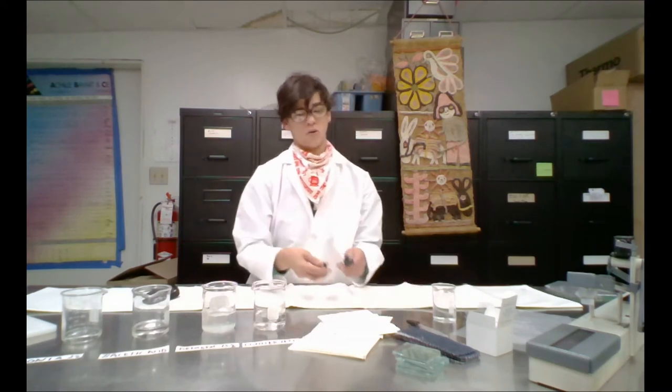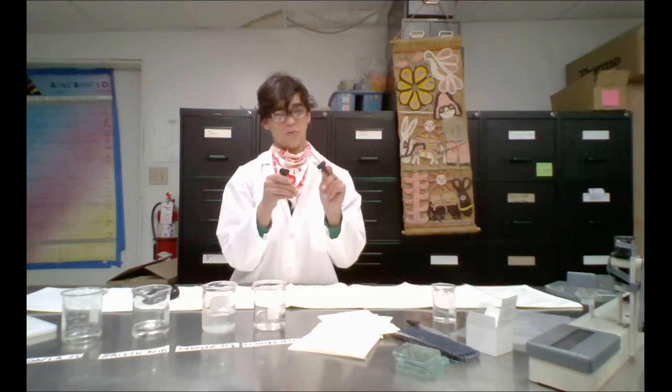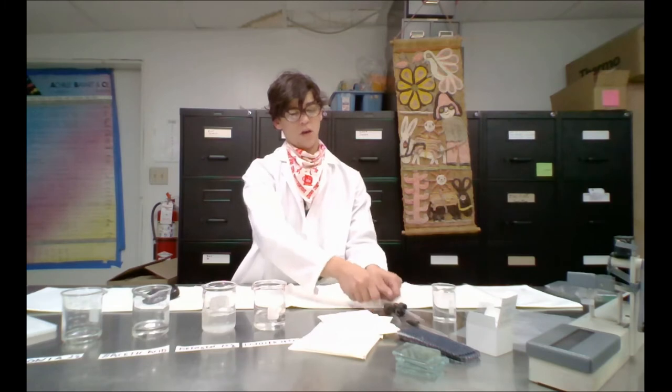You can use pipettes or we're using eyedroppers. They also have a brush swab in the materials section but we won't be using those right now.